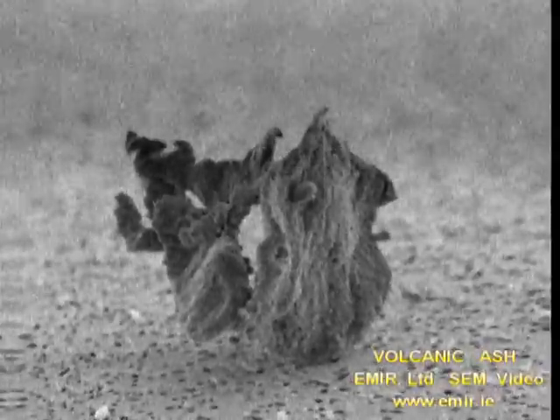This volcanic ash particle measures approximately 40 micrometers in diameter, and was collected on April 17, 2010, as the volcanic dust cloud drifted from Iceland to finally reach Southwest Ireland.